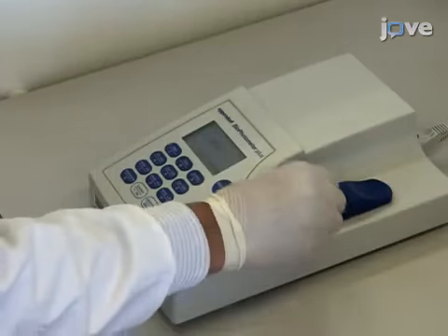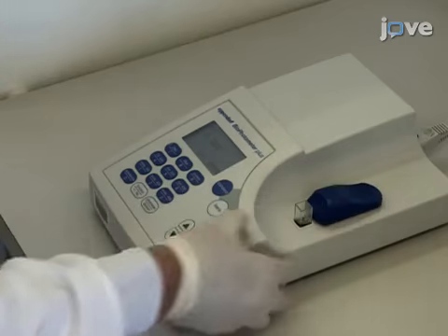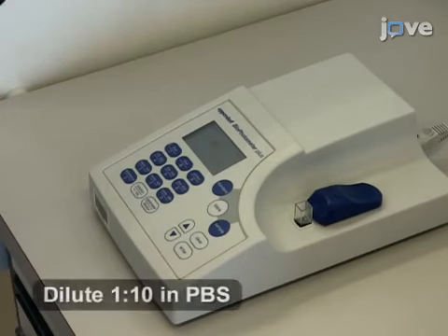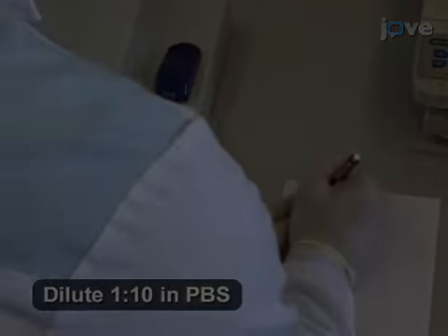The next day, determine the concentration of Salmonella in the overnight culture by measuring the optical density at 600 nanometers, or OD600, of the diluted culture against phosphate-buffered saline.